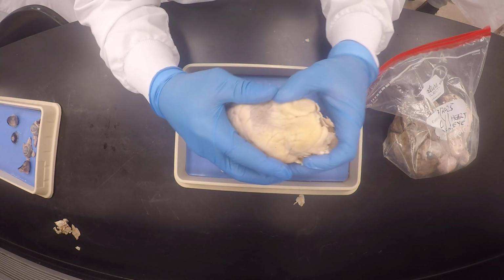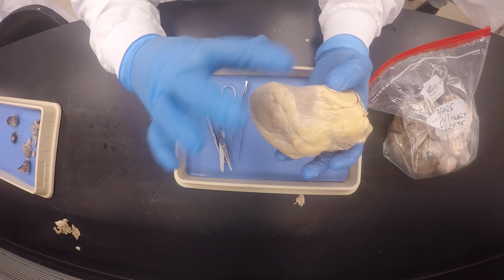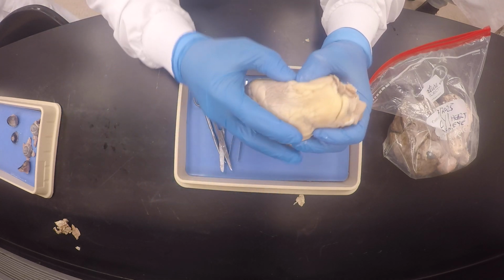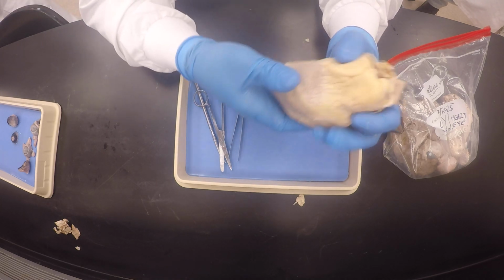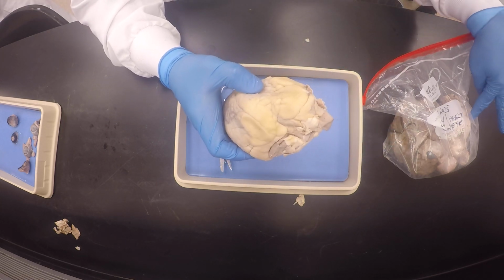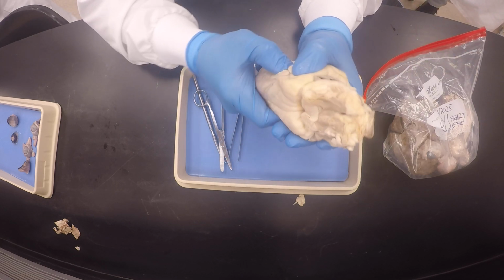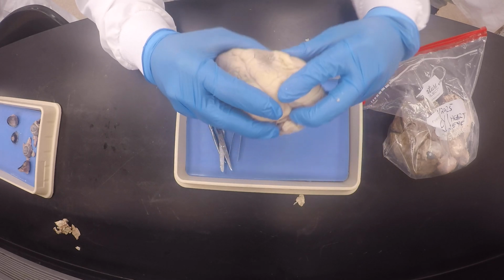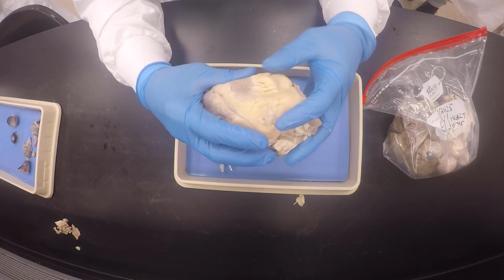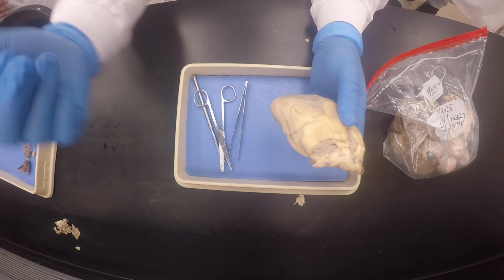Okay, but like I said, because these were vacuum packed, which is not ideal, it will contort the organ any which way. So this is why I'm playing with it. And hopefully I get real lucky and make a good cut, like I got lucky yesterday. I really did make a good one. So I kind of had to play with it like this a little bit. Do you see how I'm making it round, so that it's not going to cut through my stuff? You see, all this fat is necessary, and my nose is itching, and I cannot.